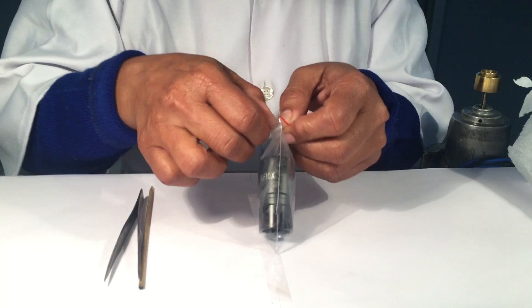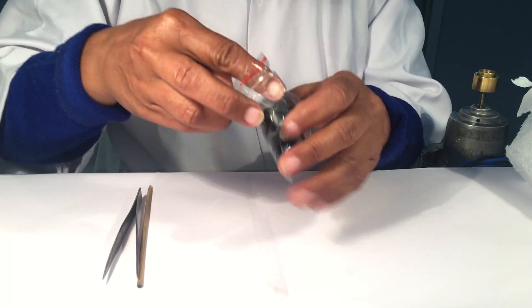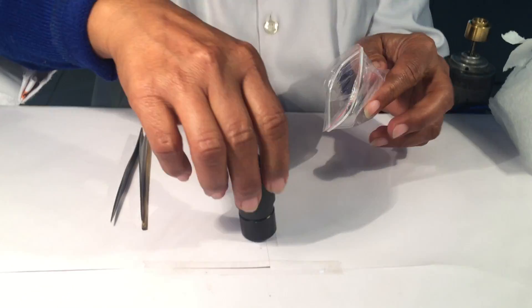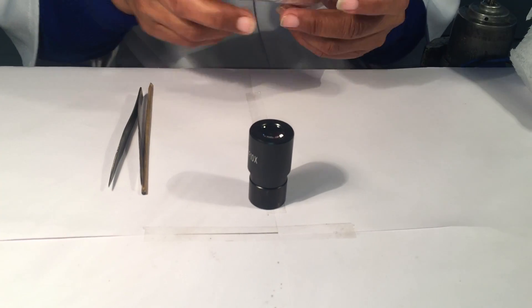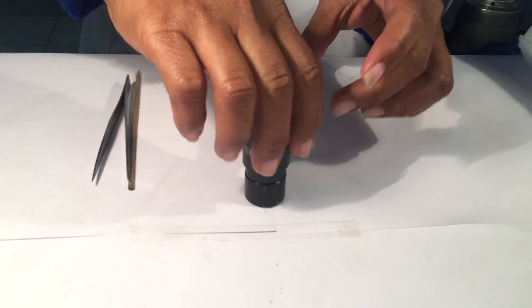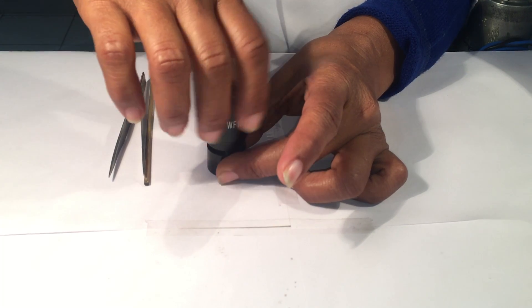So we will unpack the WF10X eyepiece, we will unscrew the upper part.